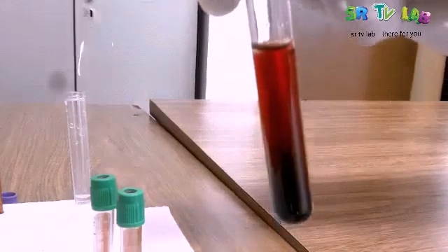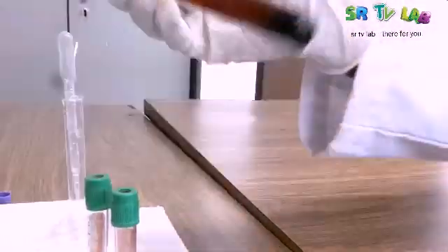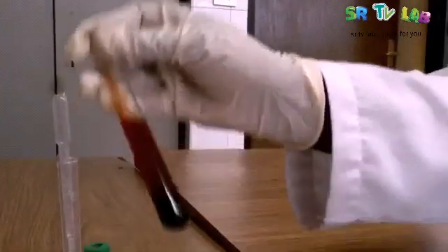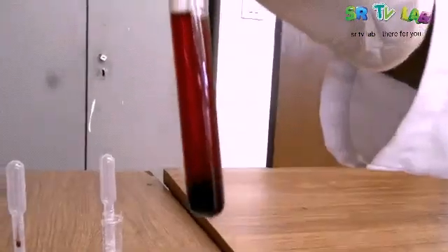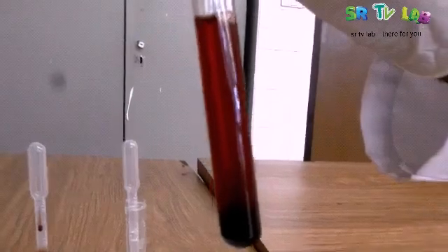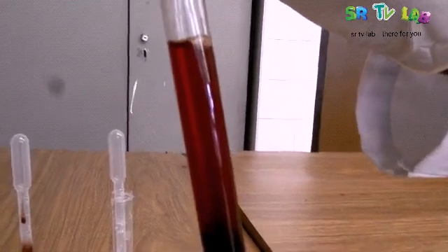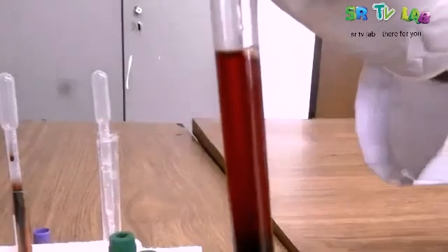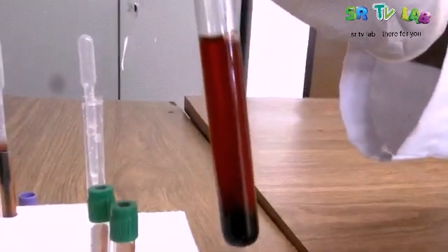The same as when you shake blood, the red blood cells — the electrolytes are going to be mixed with the plasma and then haemolysis will occur. We are shaking again. Now you see how it is looking — it has become more translucent. This is an indicator that the red blood cells got much water and then they are busted. This is what we call haemolysis. At the end we are going to compare this blood that has undergone haemolysis with normal blood to see if there is any difference.